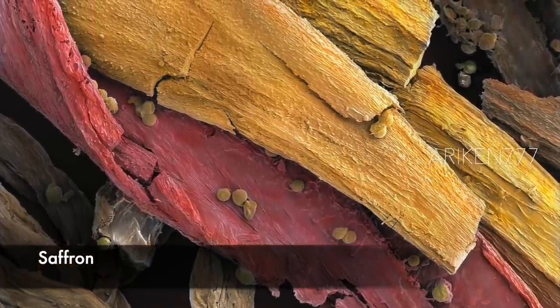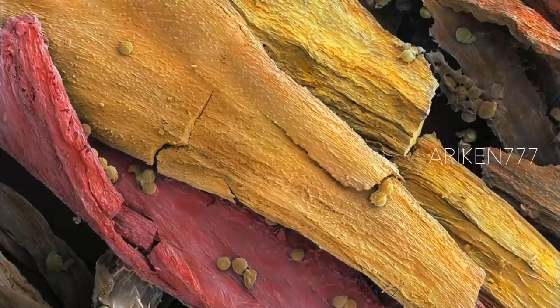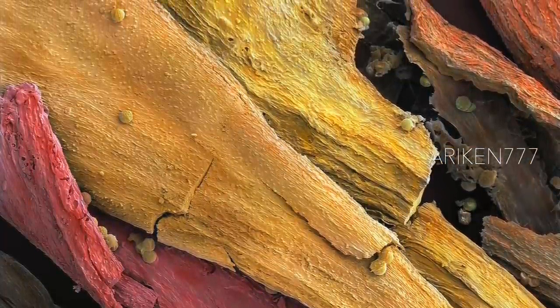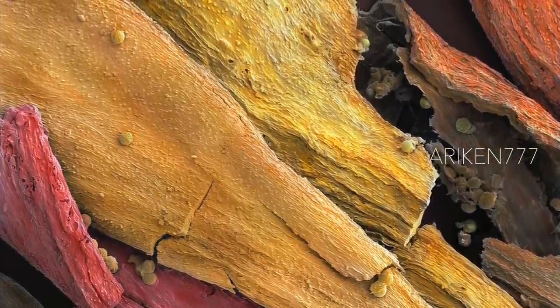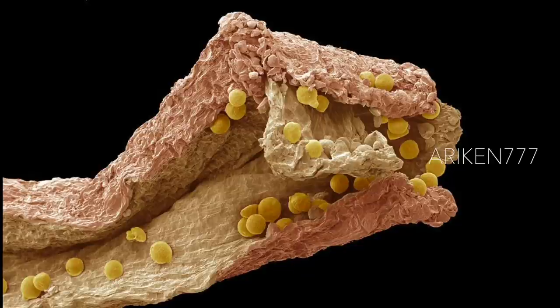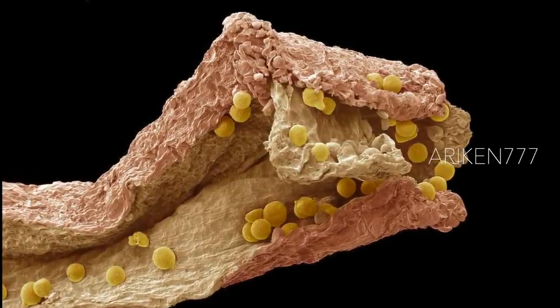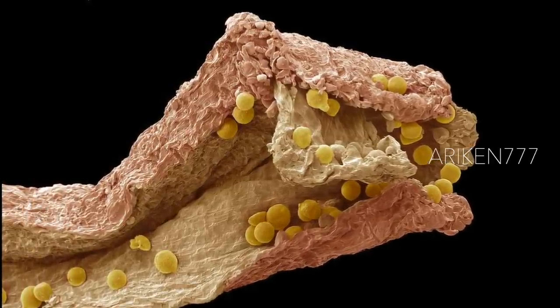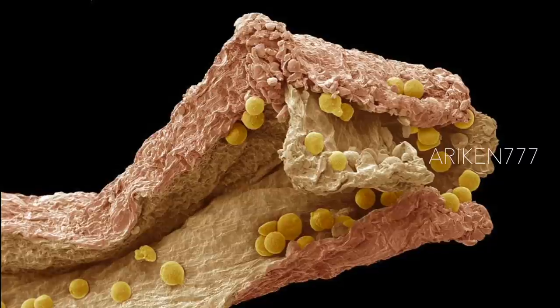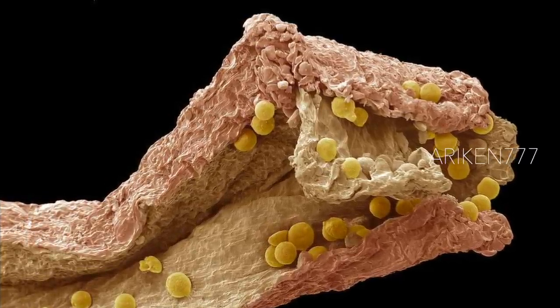Saffron is a spice derived from the dried stigmas of the saffron crocus flower. Also visible in this image are crocus pollen grains. The three stigmas from each flower are picked by hand during autumn and quickly dried to be used either for cooking, flavoring, or as a colorant. By weight, saffron is the world's most expensive spice.